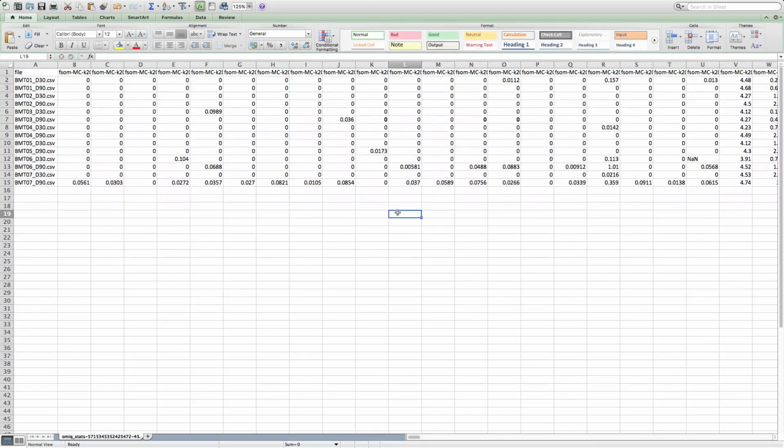To deal with this, really the only option, if you're not okay with 0, is to remove the cluster from the analysis or to remove the file from the analysis. But that does leave us maybe in a tight situation, because then the rest of these files can't be analyzed on that cluster. So 0 might just be okay for you.